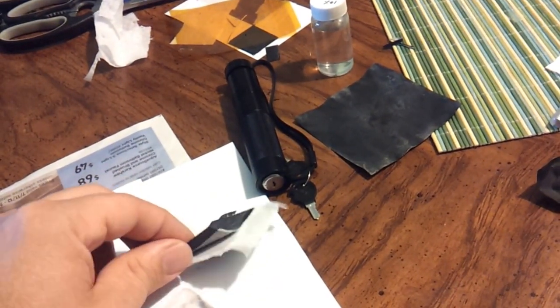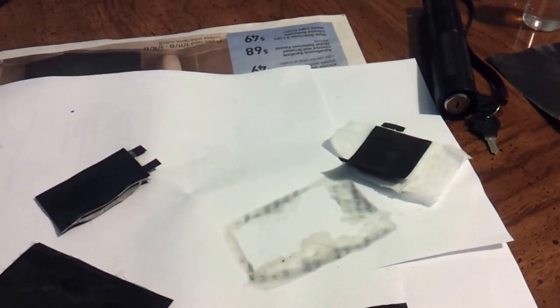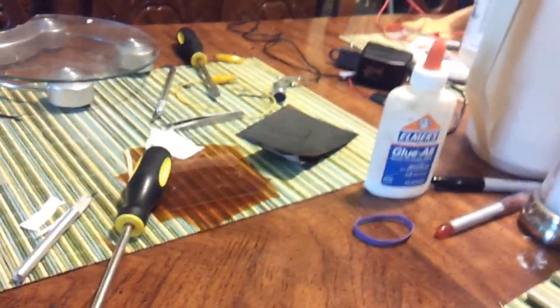Here's another one where I just left it and it dries out and it still does not do anything. Ugh, it's horrifying. Unless I'm supposed to dry it out, but nowhere did it say that. And then there's more and more and more goodies on the table. But back to more promising things.